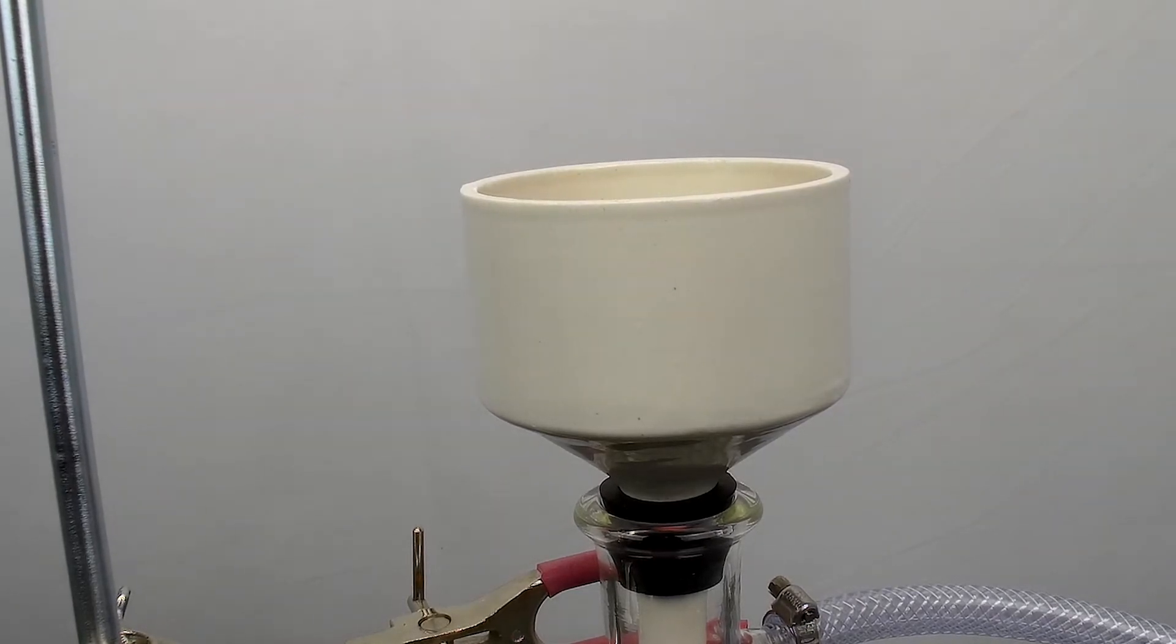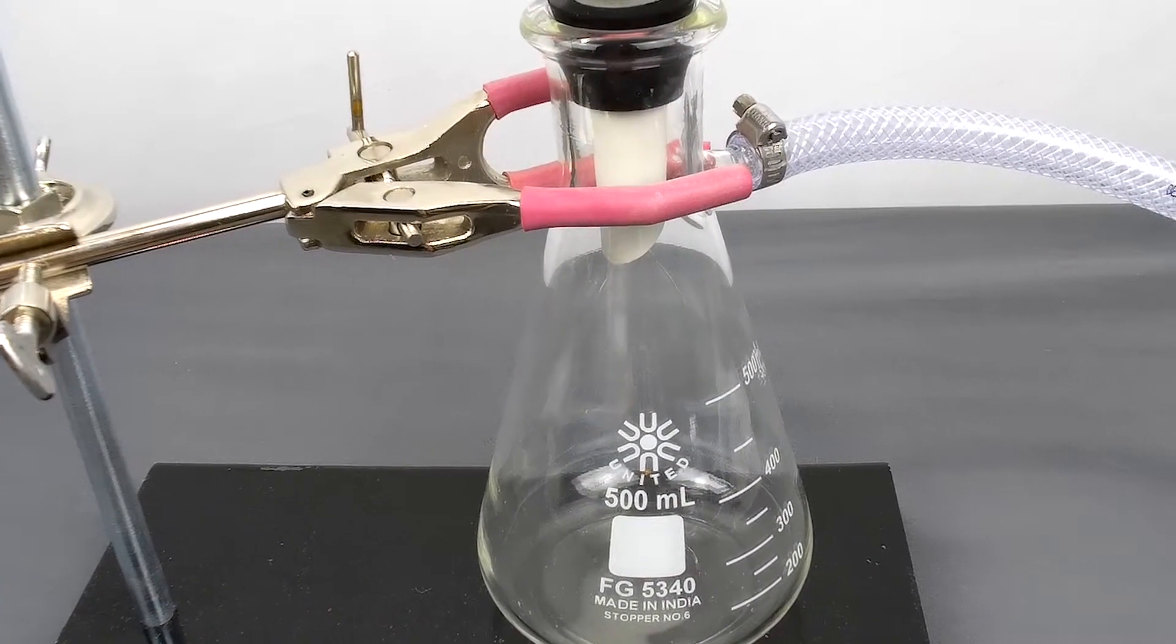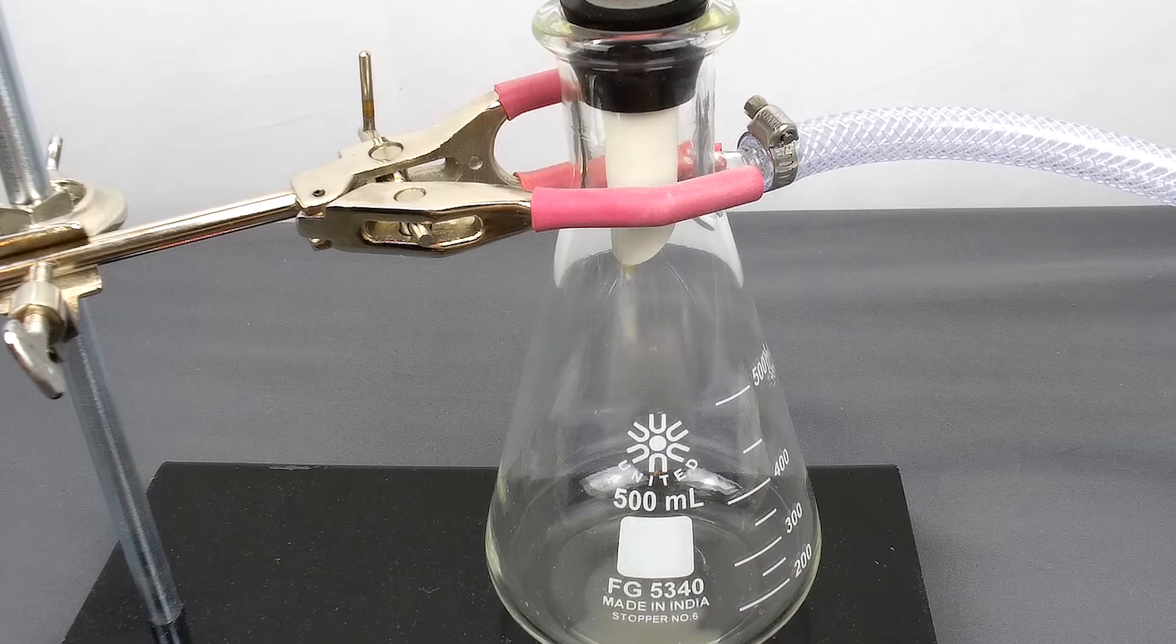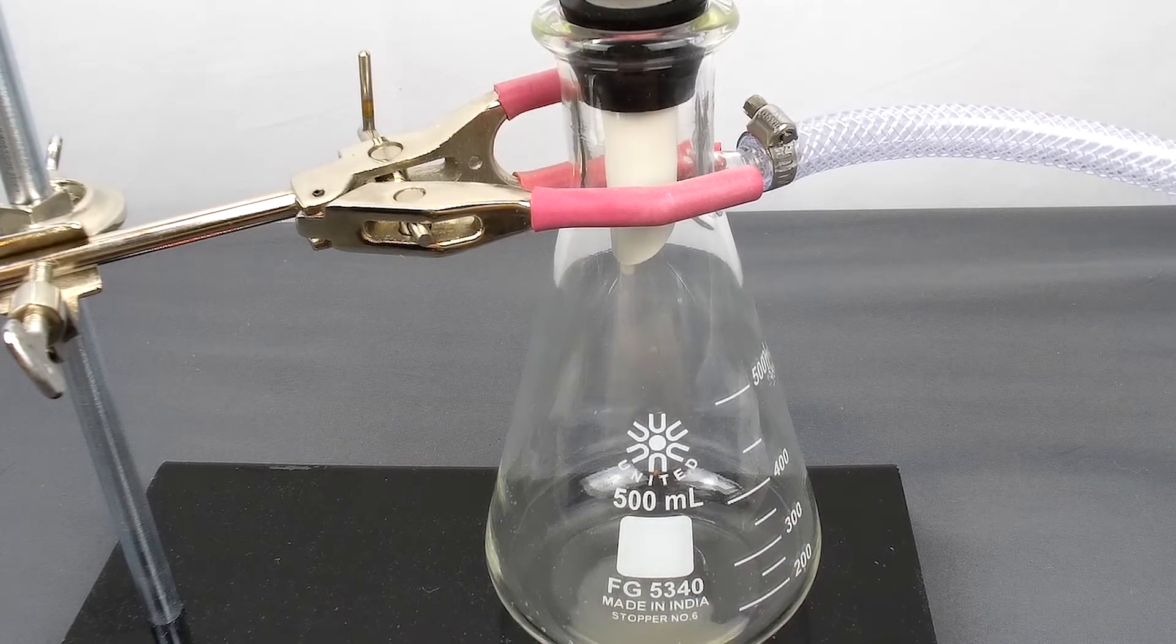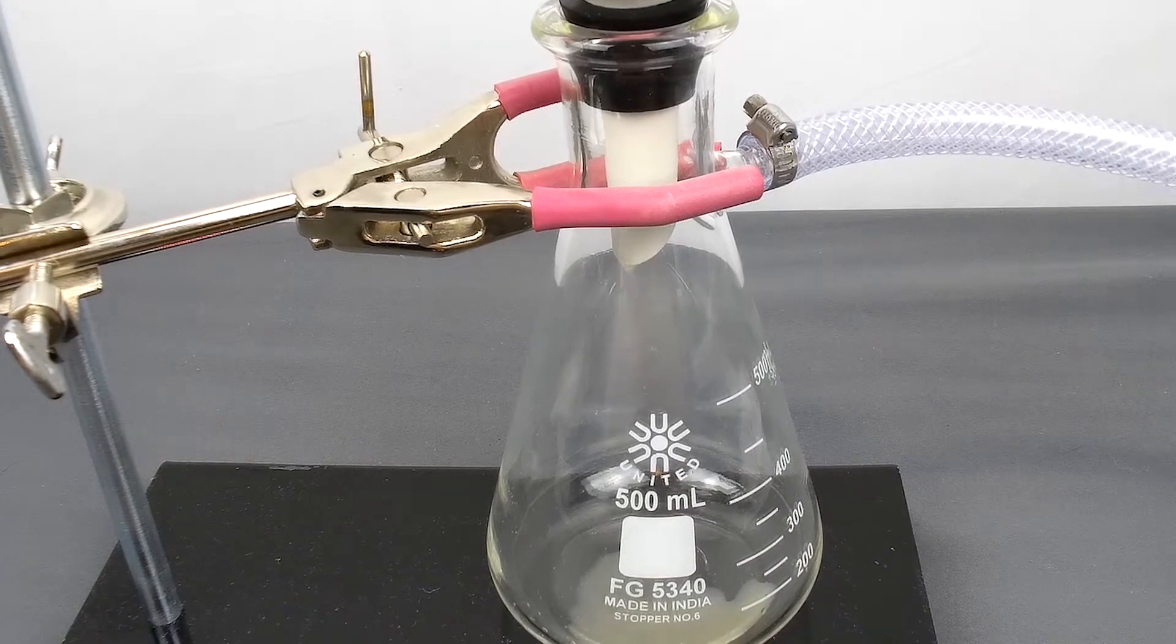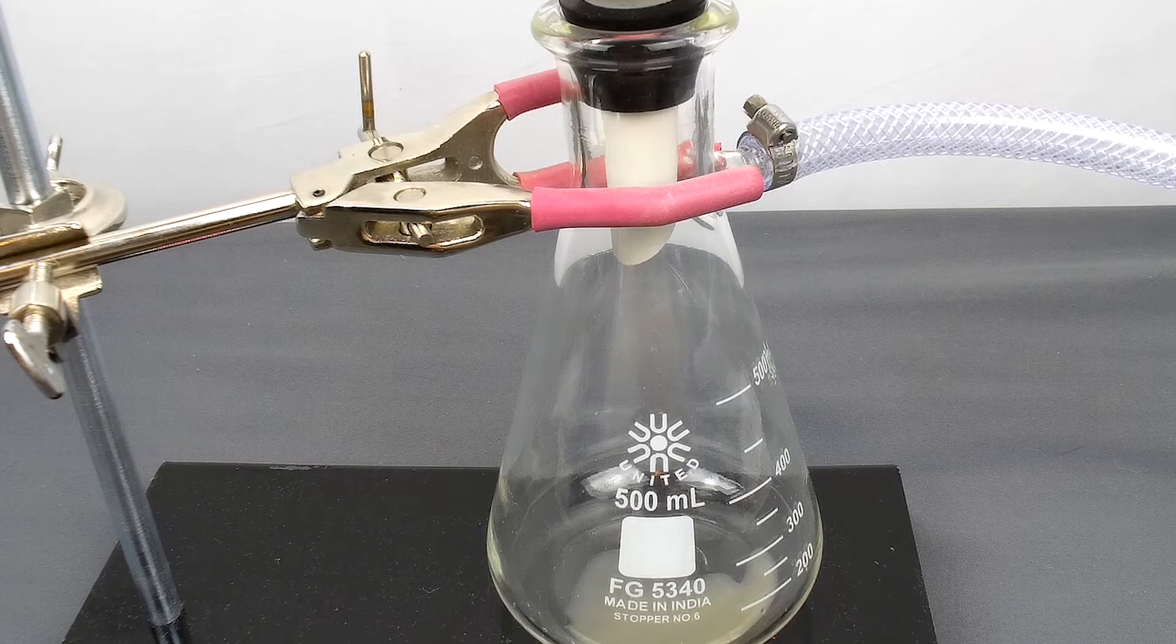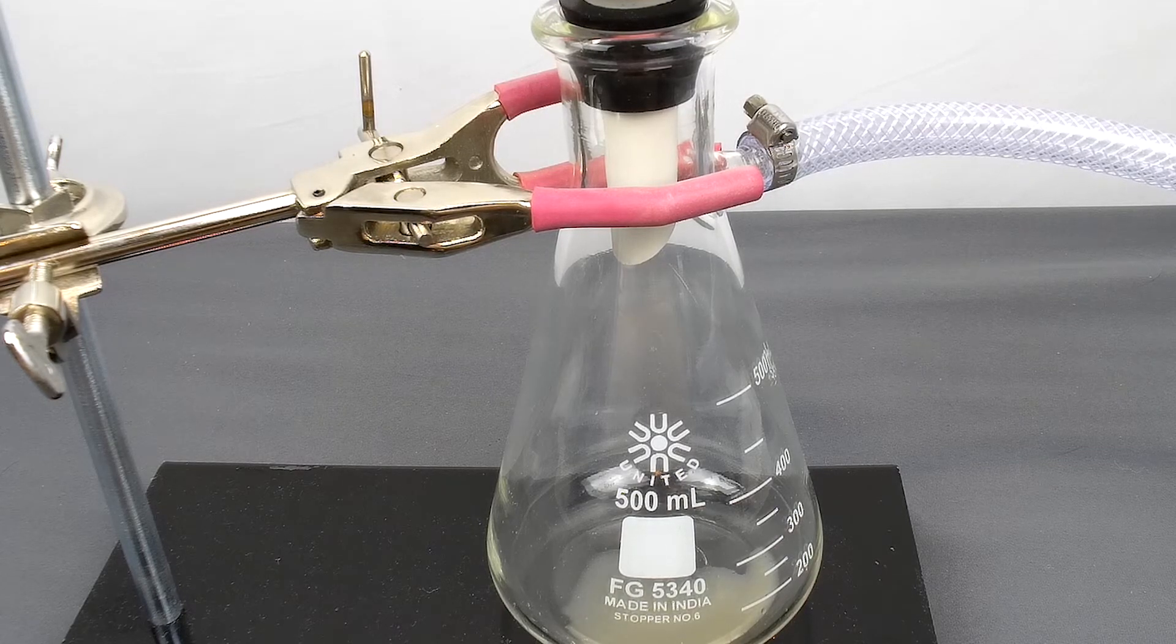You can show the students how this is dripping. Gravity does make it work, but when I start pumping the air out, I definitely get a much better flow than just by gravity alone.